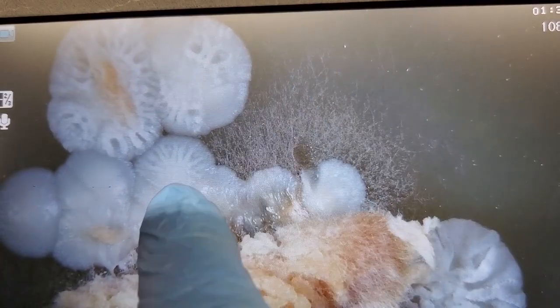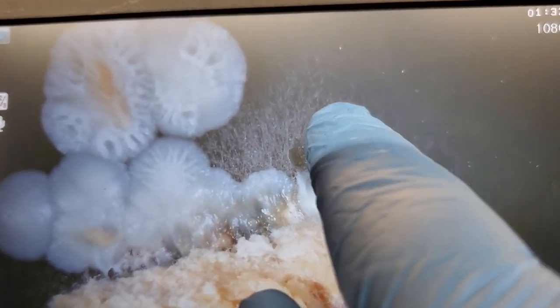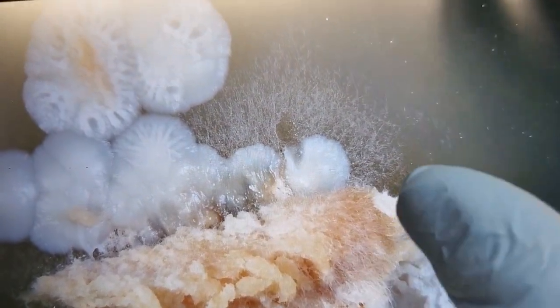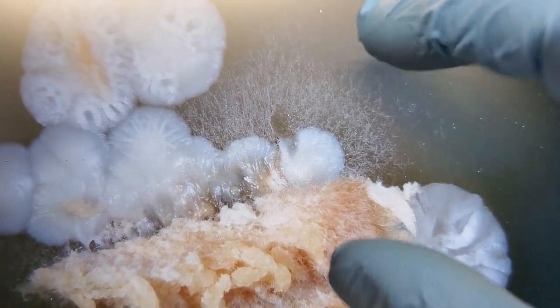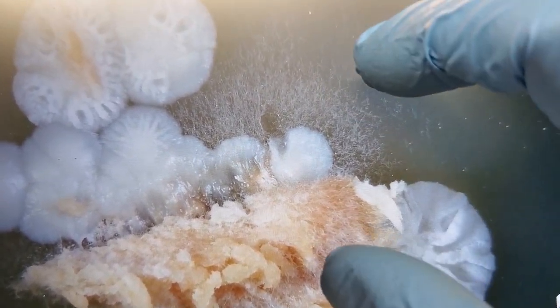But like I was saying, if you absolutely needed to, on this one right here, we could take a chunk of this agar petri dish from this spot, and then we could simply transfer that onto another sterile petri dish, and as long as that itself doesn't carry any contaminations over with it, we could let it grow out, and then that could be our colonized petri dish for this particular example of chicken mushroom.